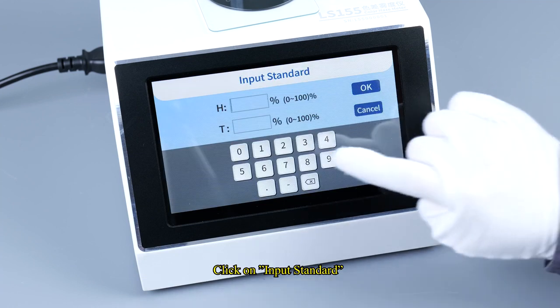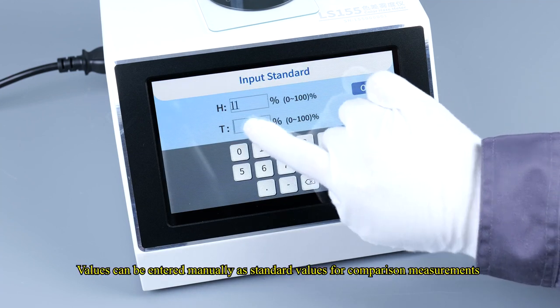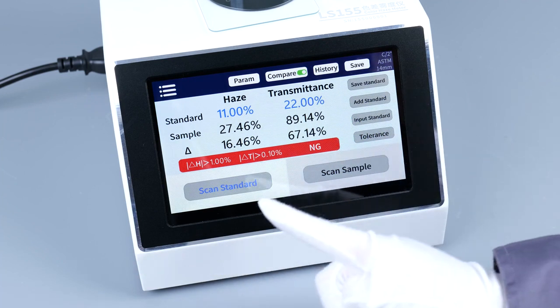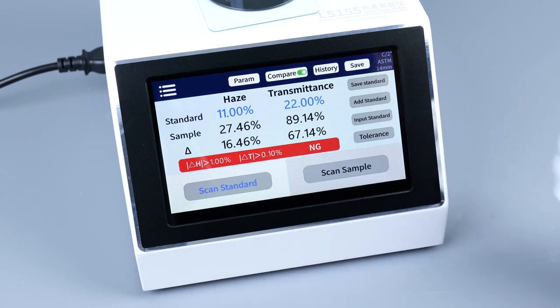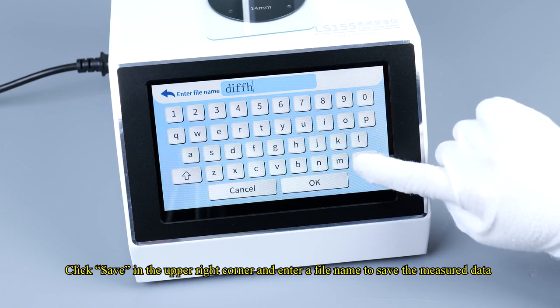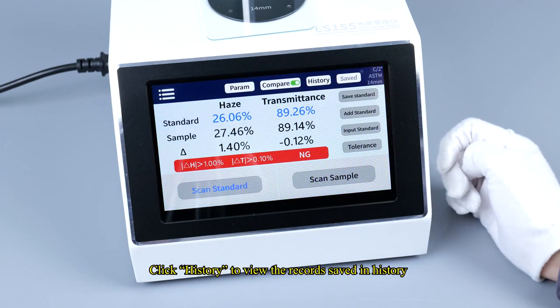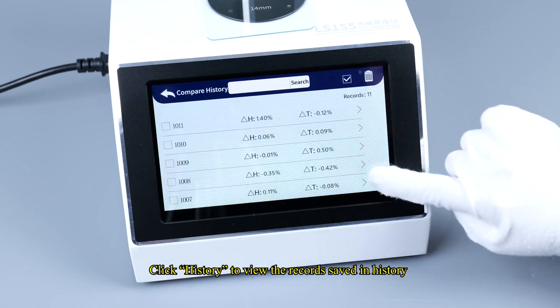Click on Input Standard. Values can be entered manually as standard values for comparison measurements. Click Save in the upper right corner and enter a file name to save the measured data. Click History to view the records saved in history.